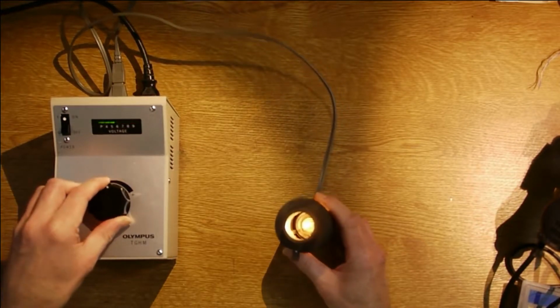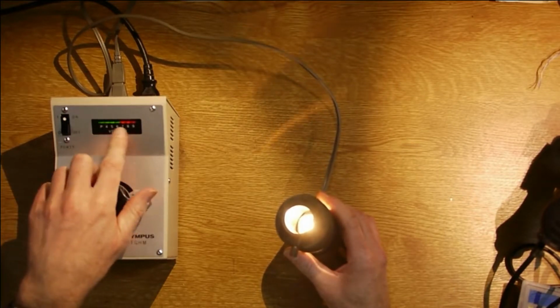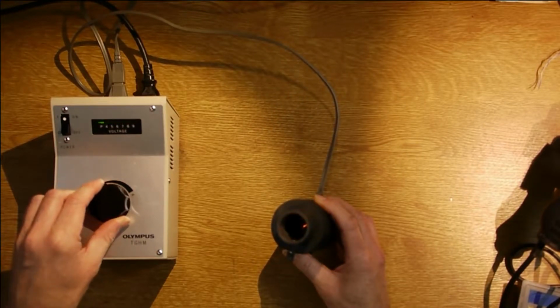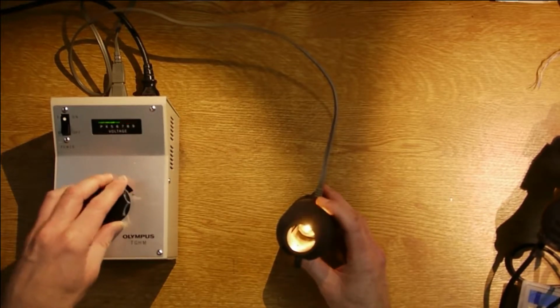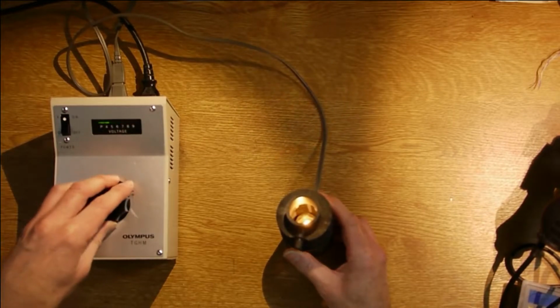Unfortunately, it's not particularly bright. In order to get any decent brightness out of it, you've got to go into the red on the transformer. So I wasn't too happy with that. Also, it's a bit orange when it's dim, and there's probably a bit of orange when it's brighter.